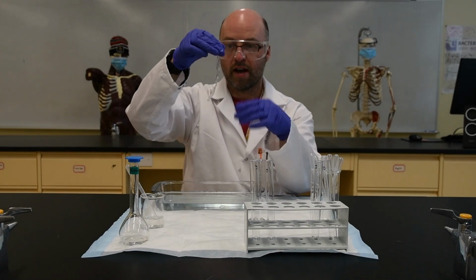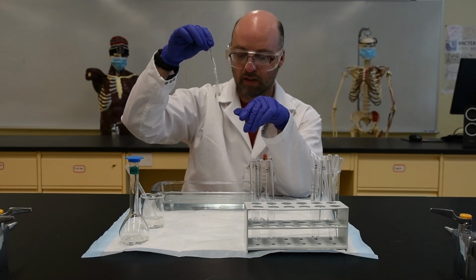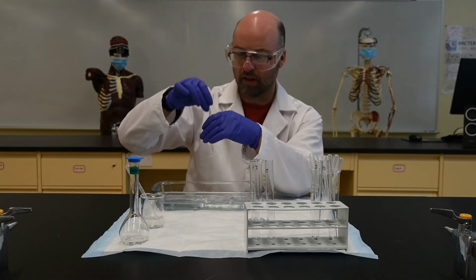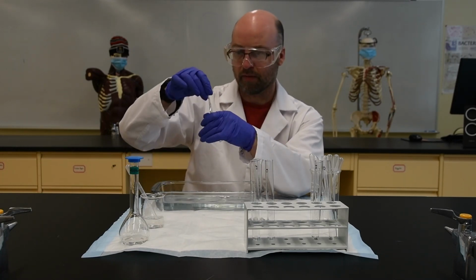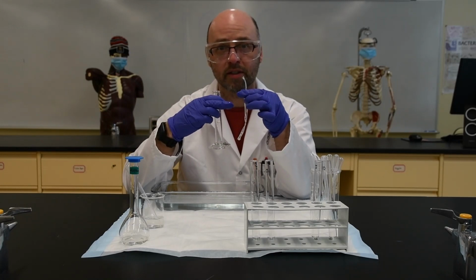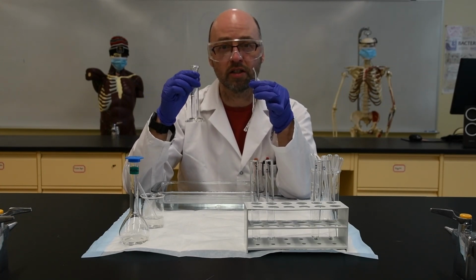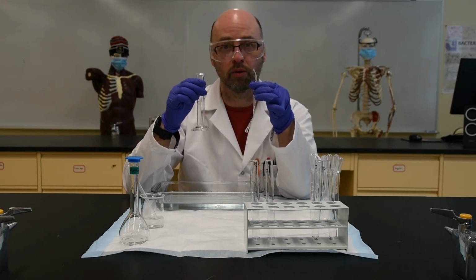So now we have the mixture of the solutions inside the bag, and what I'm going to do is give this a bit of a rinse in distilled water that I've got here, just to wash any of that solution off the outside, just in case. And what I'm going to do is put this sealed tube with the 15% glucose and 1% starch inside the bag into a measuring cylinder that has just distilled water in it. So distilled water has no solutes, so it's pure water.